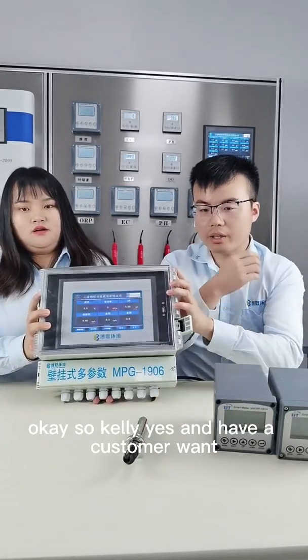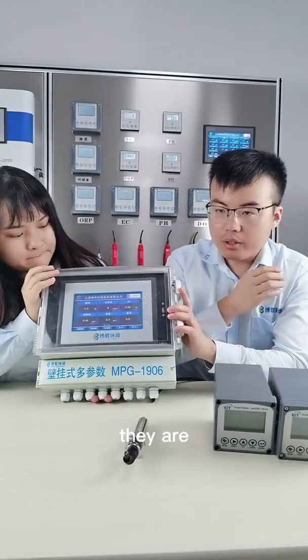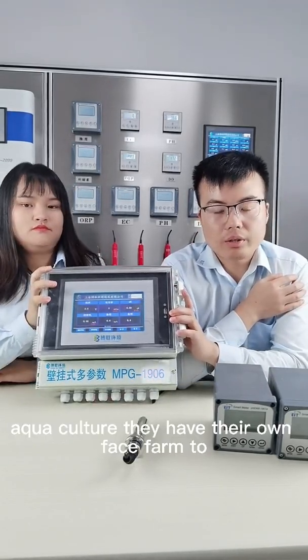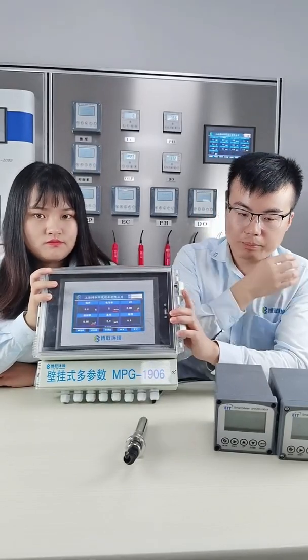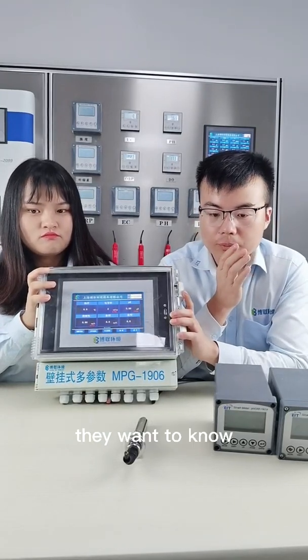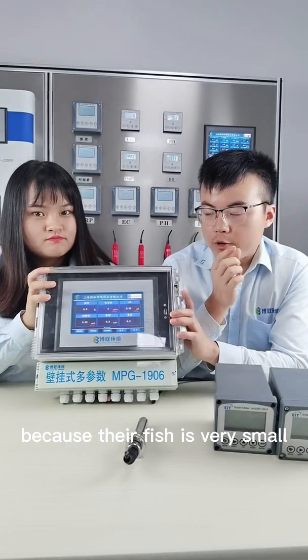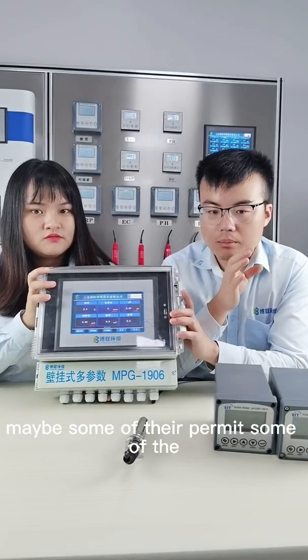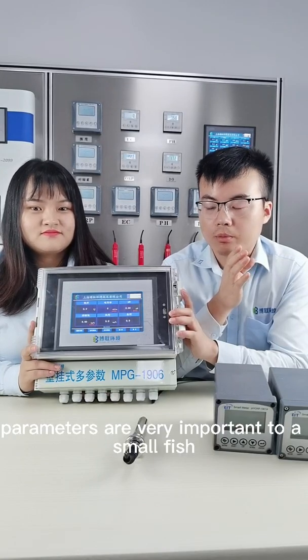Okay. So Kelly, I have a customer who wants to ask. They are in aquaculture. They have their own fish farm, and before they order this product, they want to know what parameters they need to test, because their fish is very small, and maybe some of the parameters are very important to small fish.